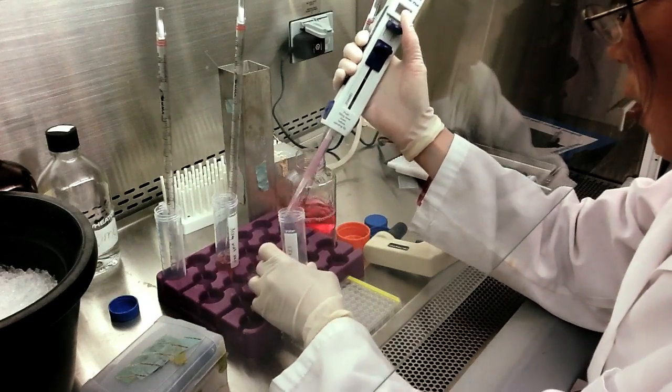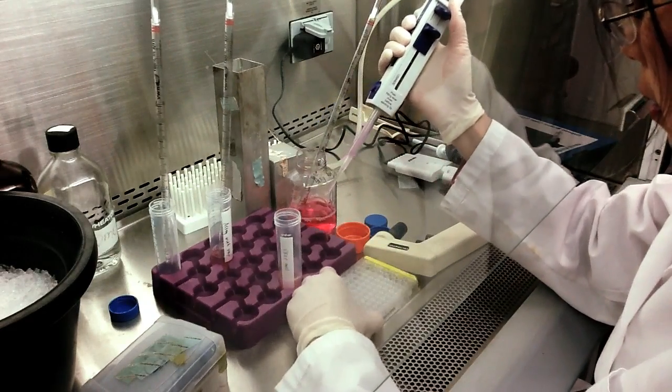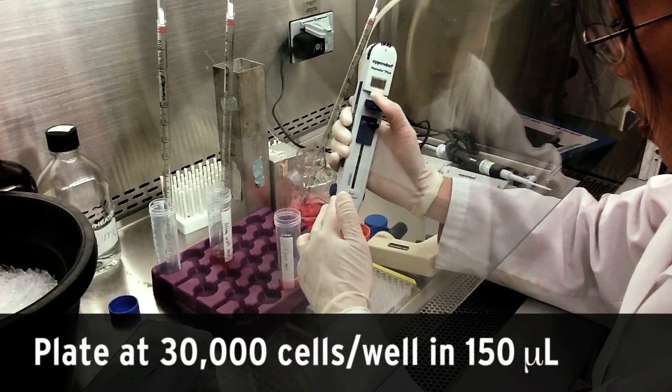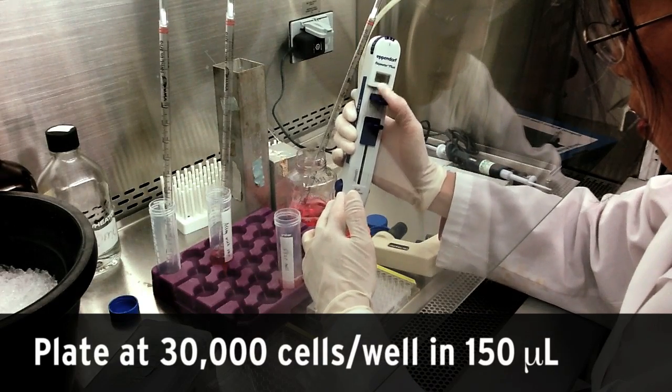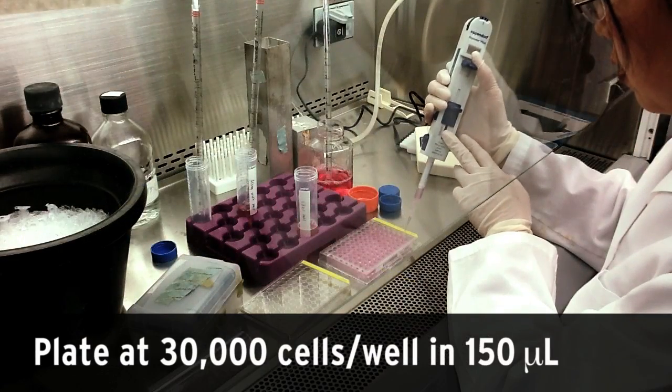Cells are then plated in a flat-bottom 96-well culture plate in a concentration of 30,000 cells per well in a volume of 150 microliters.